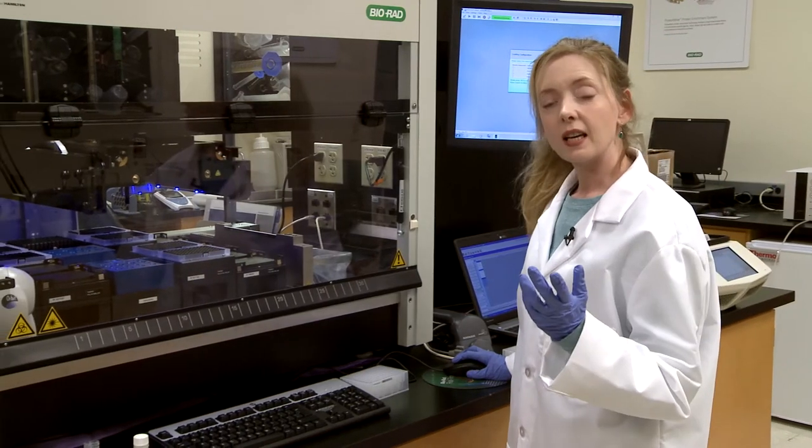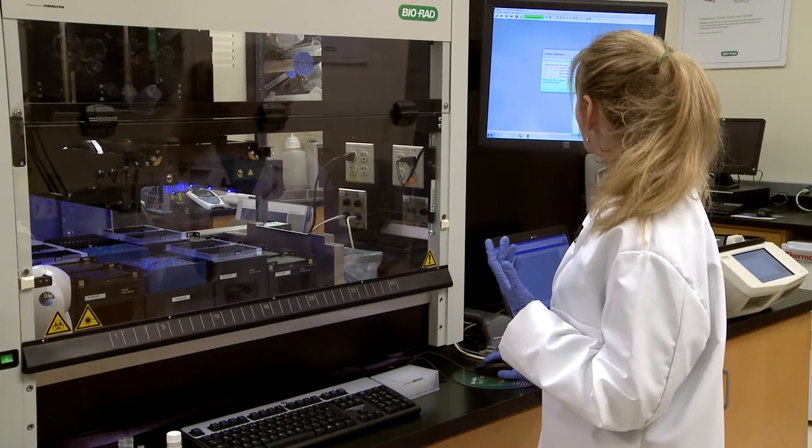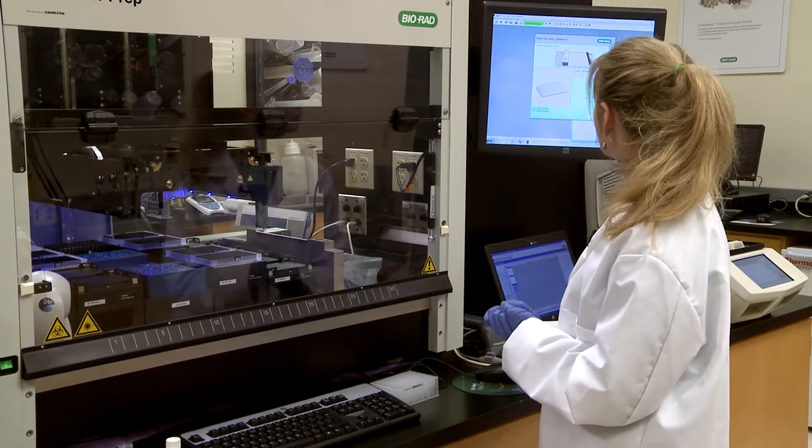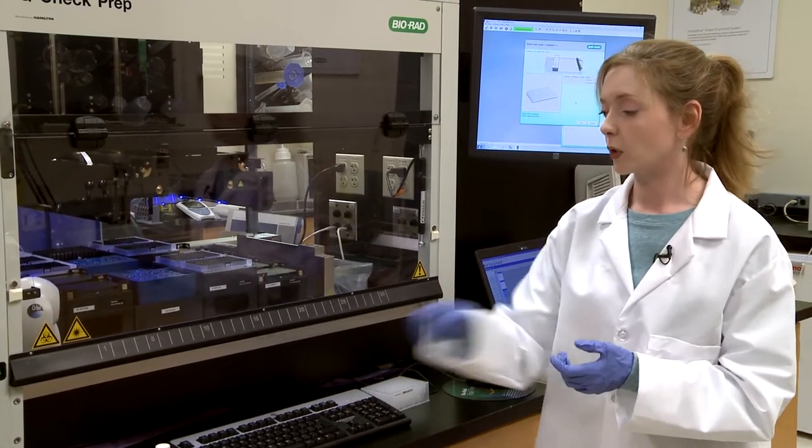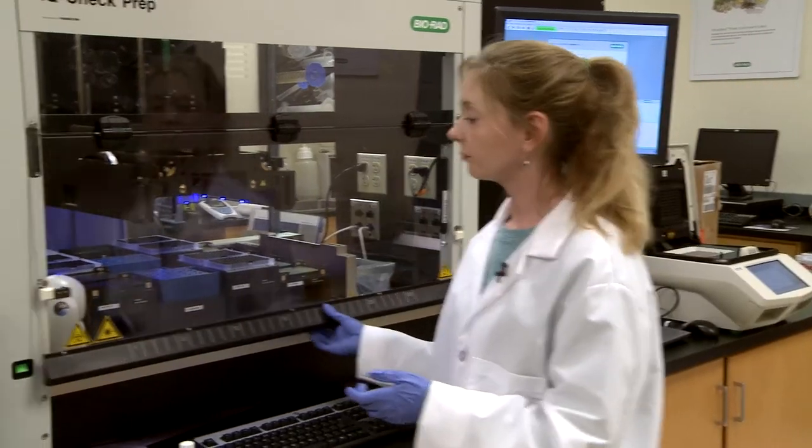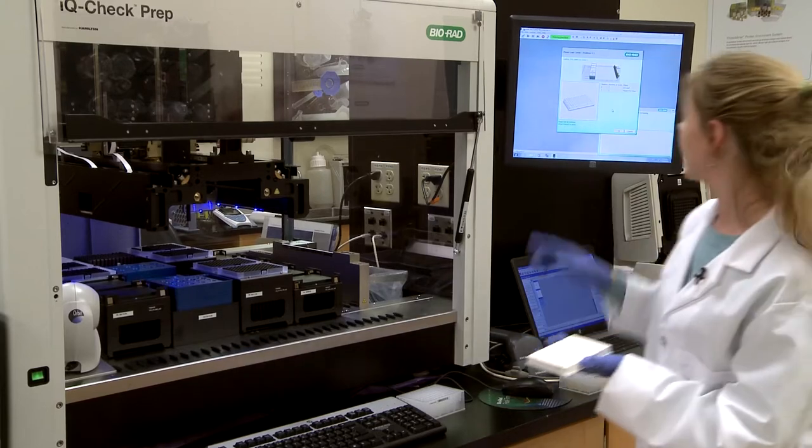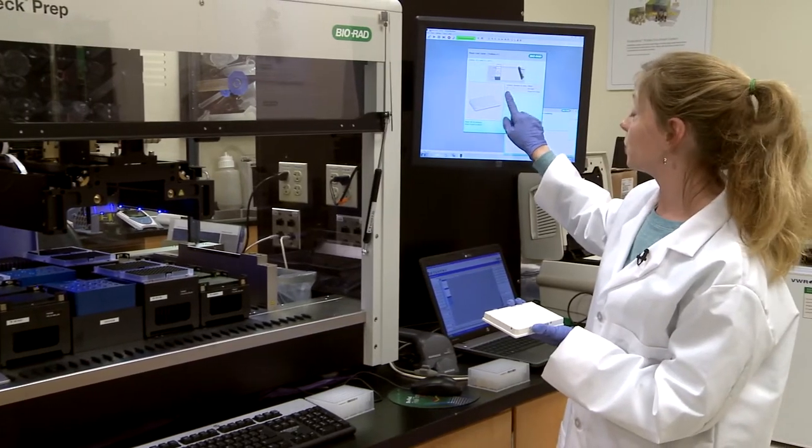At this point it's asking me about what to do next and we're going to keep going and it's going to tell us to put the PCR plate in. So open up. Now the PCR plate needs to be loaded into position five.